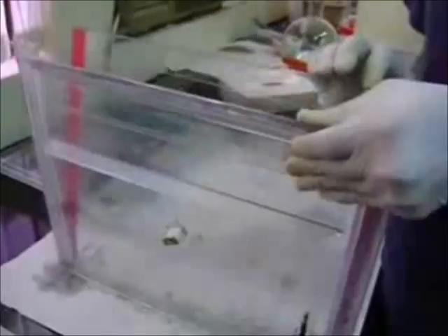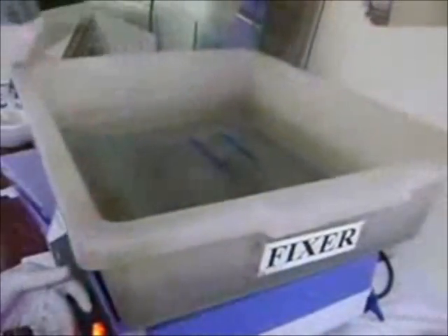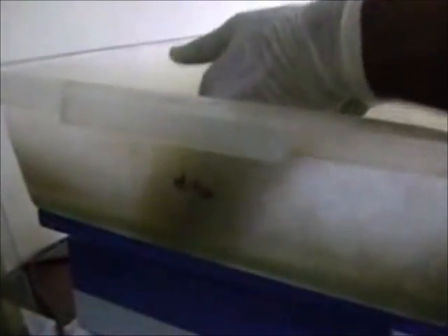The buffer is drained and the IPC base and glass plates are separated. The plate is kept in fixer and washed with double-distilled water. The gel is then stained with silver nitrate solution and again washed with double-distilled water. The gel is treated with developer until the bands appear, then air dried and documented. The presence and absence of bands were scored as 1 and 0.